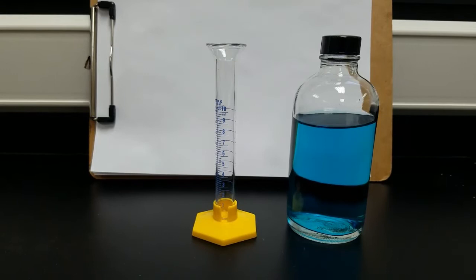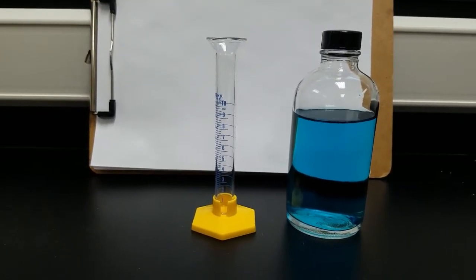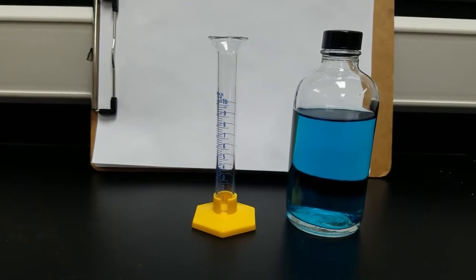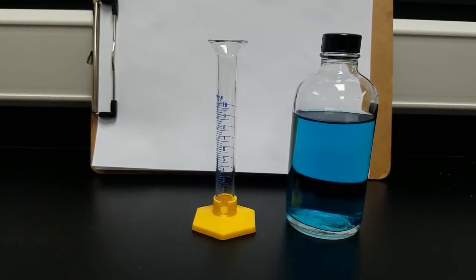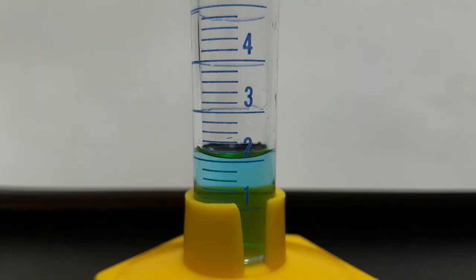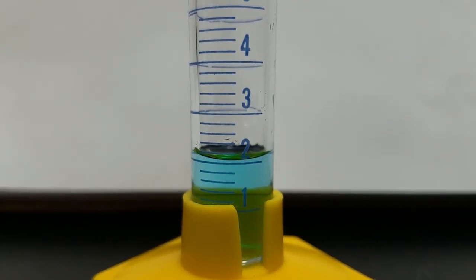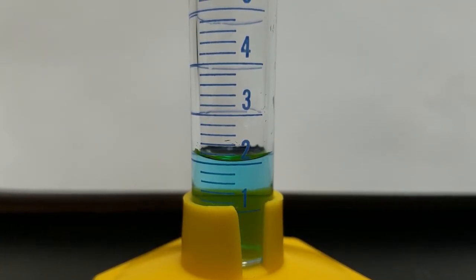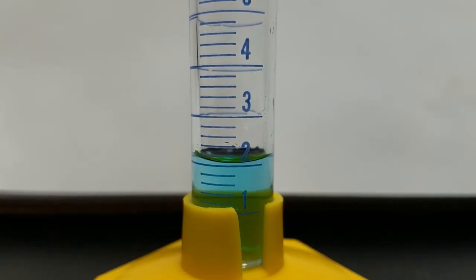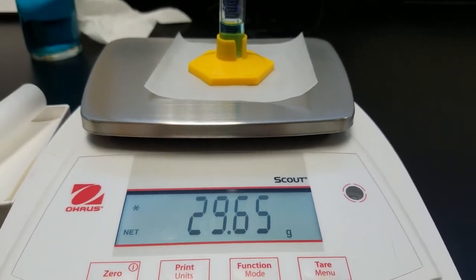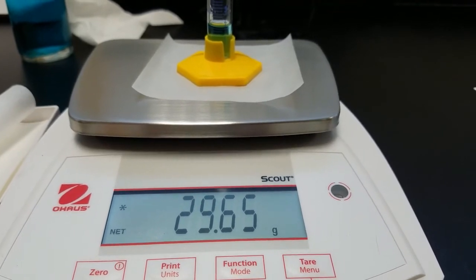I am going to add water to the graduated cylinder to about two milliliters. I have used some food coloring to make it easier to read the volumes on video. Read the volume of the meniscus from the bottom of the meniscus in the graduated cylinder. The mass of two milliliters of water.